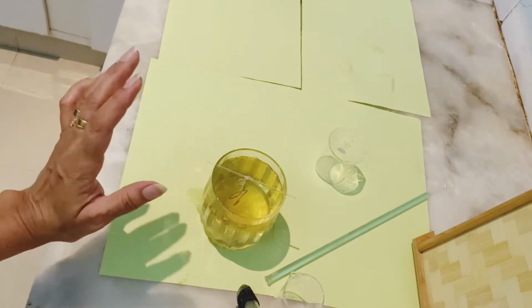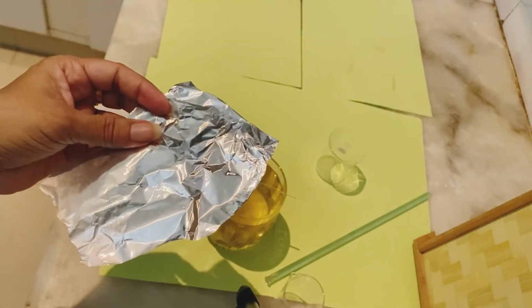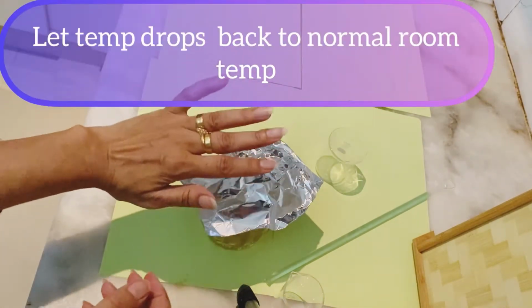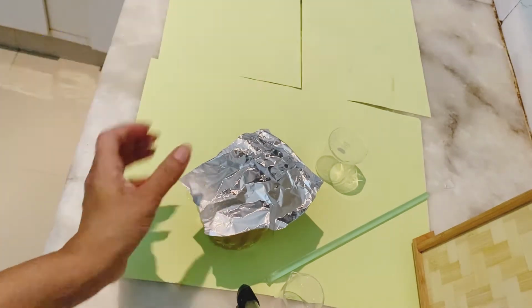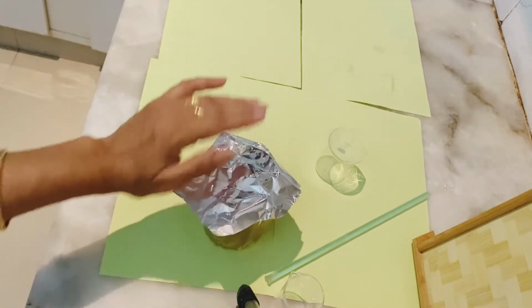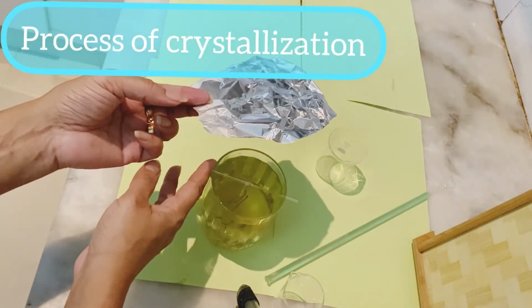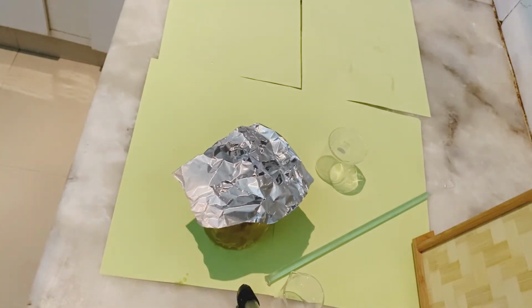Now I will leave it there undisturbed for some time, because I want it to slowly cool down, and I don't want to block all the air, so it has to be kept here for some time. With this I will just cover it like this, and I want the heat to escape also, so I will just cover it in this way, so that the process of crystallization goes along slowly and easily with the passage of time.